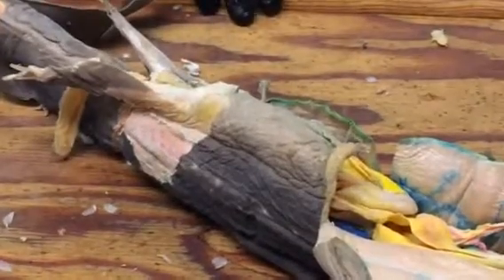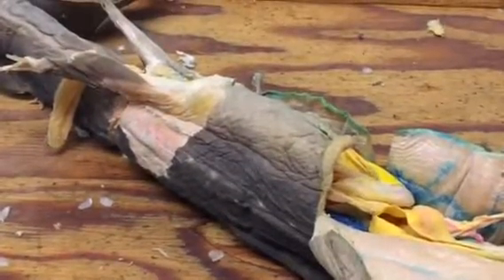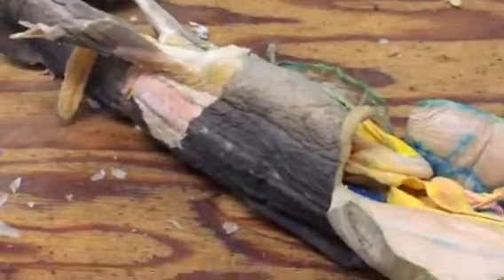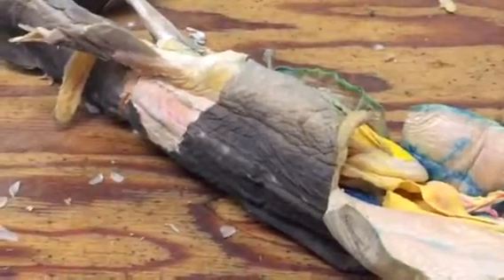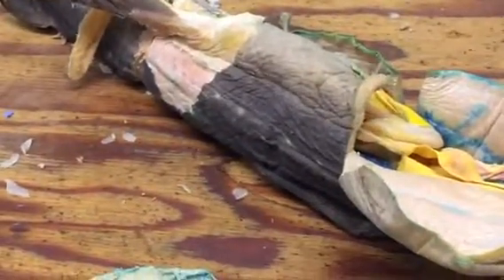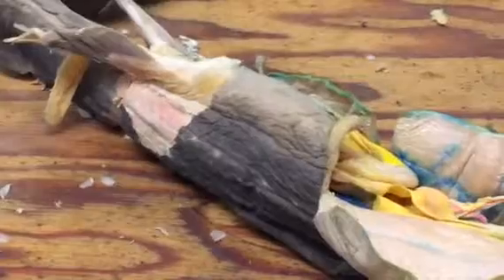Intersegmental arteries and veins, I'm not going to try to show you, but those are the ones that come off the dorsal aorta. Every myomere gets its own little branch off the dorsal aorta going to that segment. So they're really important, but they're often hard to dissect down to and see very clearly. I don't know, did you guys poke around for them at all? No. Not really. Okay. Renal arteries likewise are coming off the dorsal aorta supplying the kidneys. And again, they're hard to dissect, but it's just good to know that they're there.